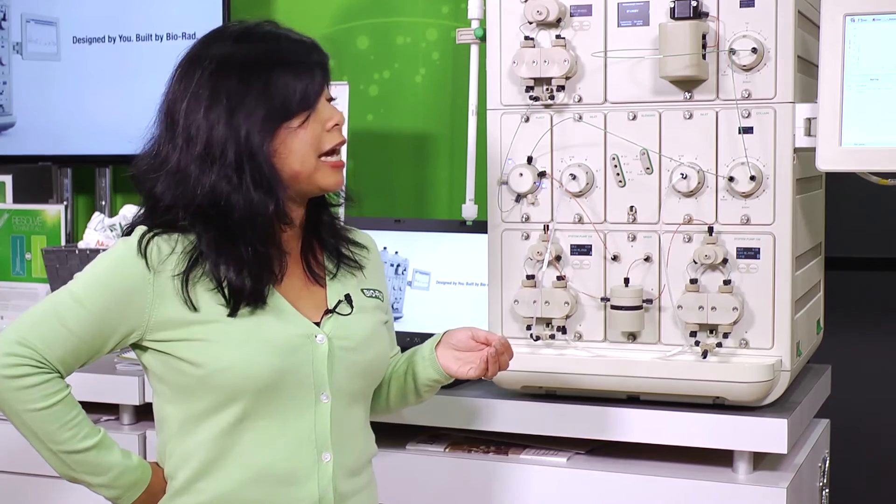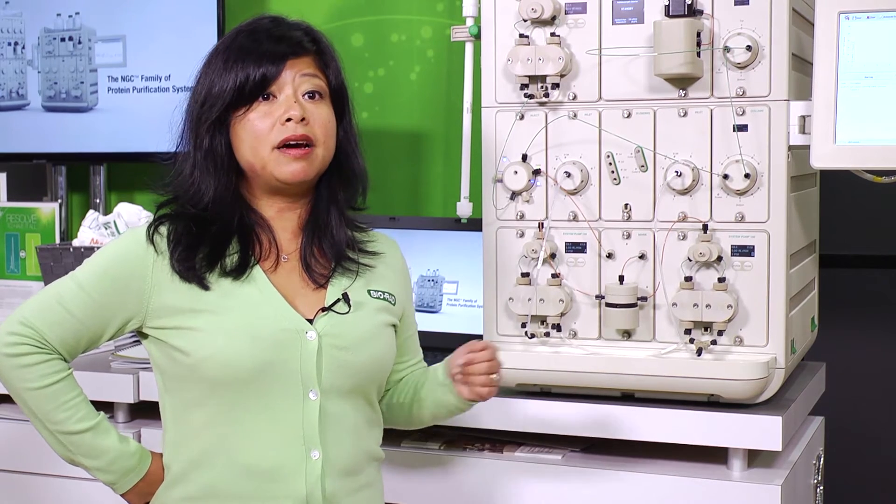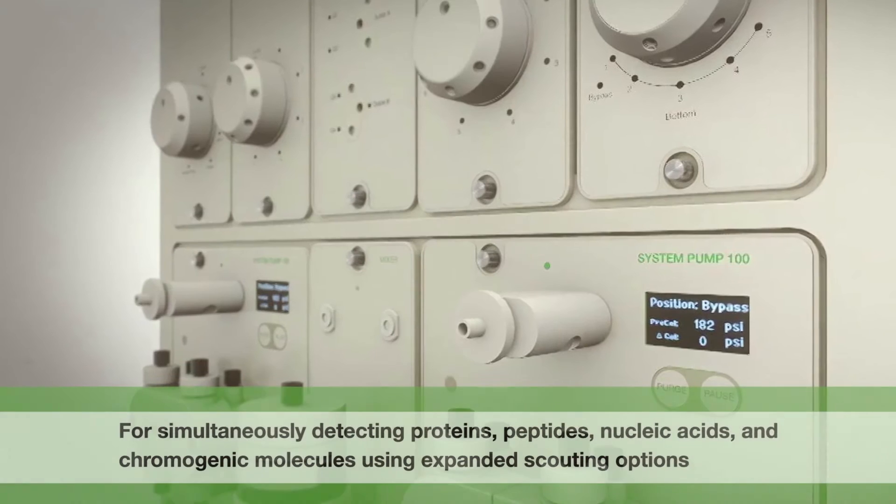Another function is to allow you to do multi-column purification, what we sometimes call 2D or multi-D purification. That allows you to have different columns in line and have the sample either go to a loop and onto another column, or go from one column directly onto another.